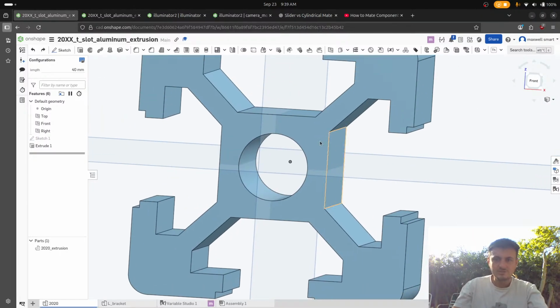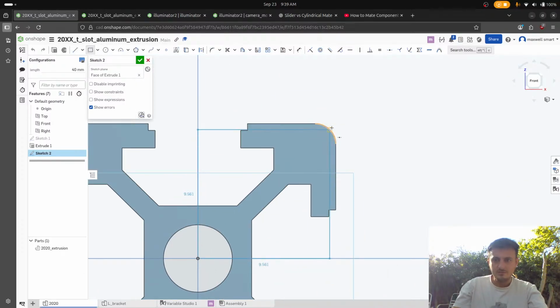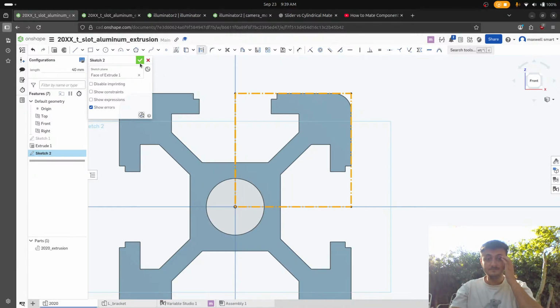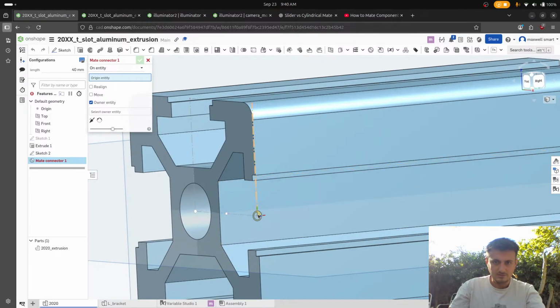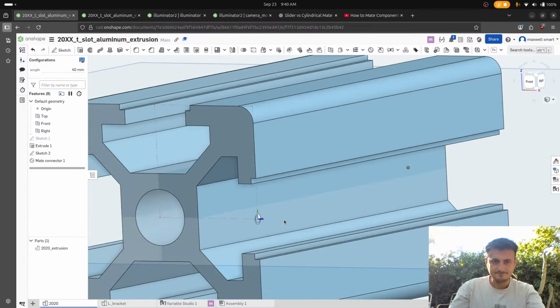Anyways, so we're gonna sketch on here. Oh wait, we want a G. Okay. And then, but we want this to all be construction, right? And then we want to do mate connector on here. I think if I clicked, let's see, I think that's what I want actually. So I want that one. And then I want that one again. Control M.